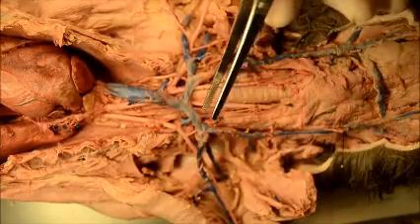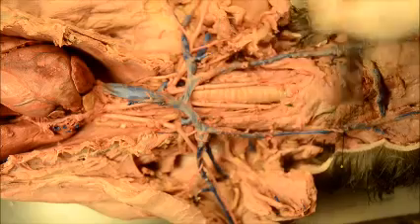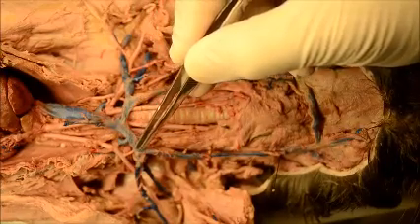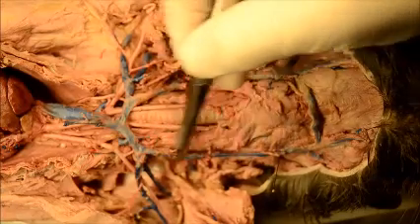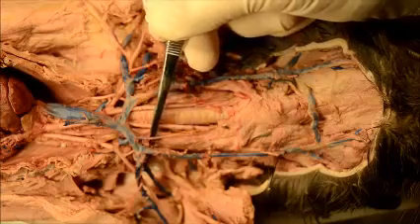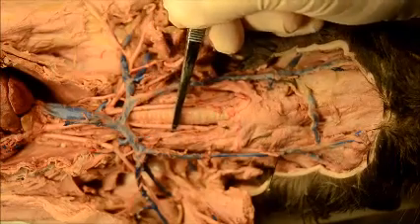I've covered the arm area and the beginning area from the heart, so let's do the head area. The brachiocephalic has vessels going up to the head — those are the external jugular and internal jugular. We're lucky to be able to see it on this cat. Look very carefully — there's a tiny little vessel right here. You can barely see a little blue latex injection that you can see on this cat. 90% of the time on cats, you won't find that one.